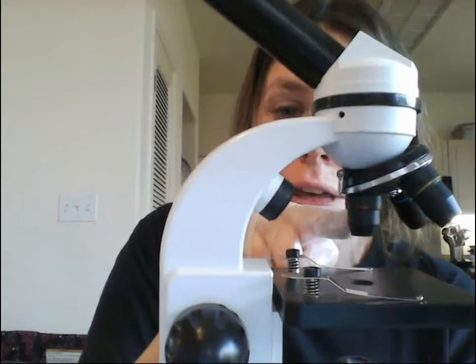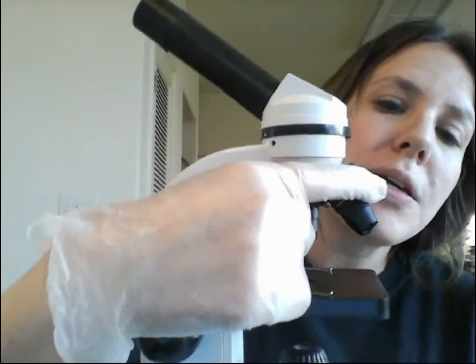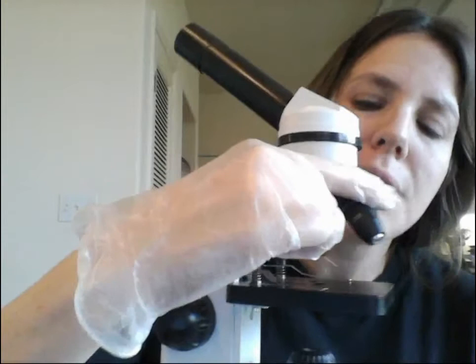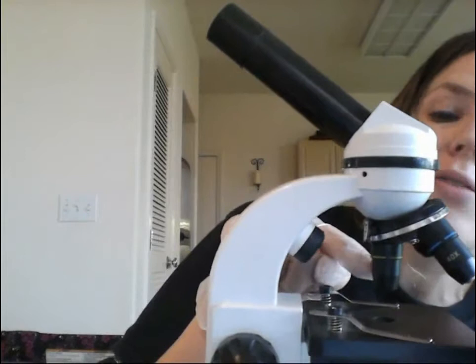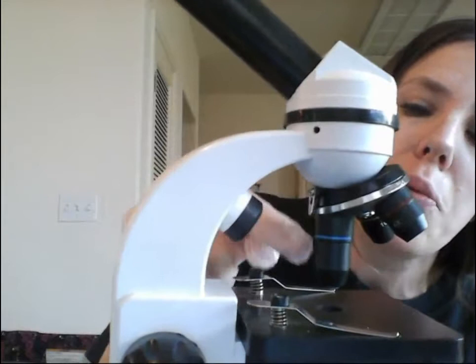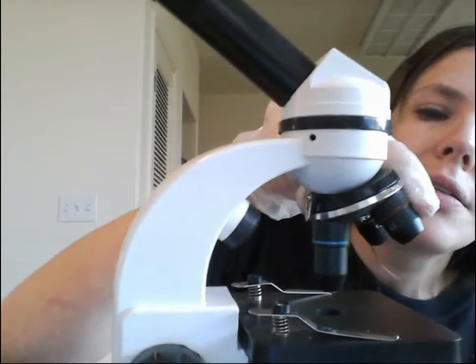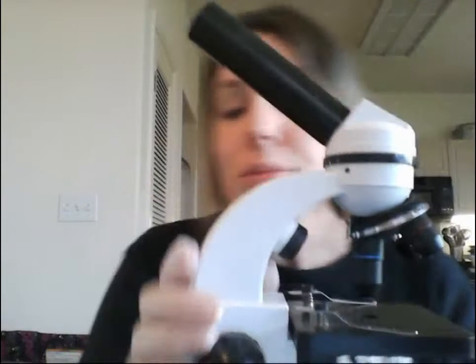The objectives come in different colors. The lowest magnification says 4x and has a red ring. Turning the nosepiece clockwise with a click moves you to the next higher magnification, which is the 10x objective with a yellow ring. Turning clockwise again gives you the largest magnification for the scope — 40x — with a blue ring. So we have 4x in red, 10x in yellow, and 40x in blue.